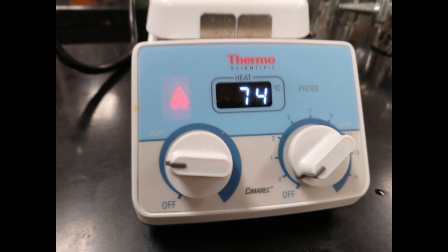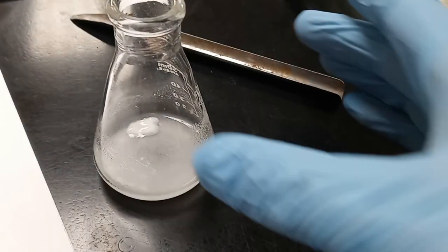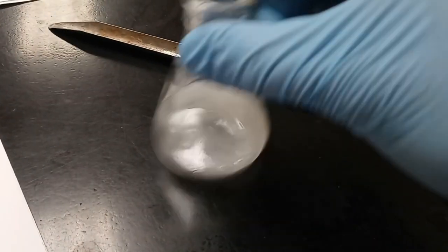The aspirin was transferred to a Buchner funnel and then filtered using a vacuum filter. Then, it was washed a few times with minimal amounts of distilled water.